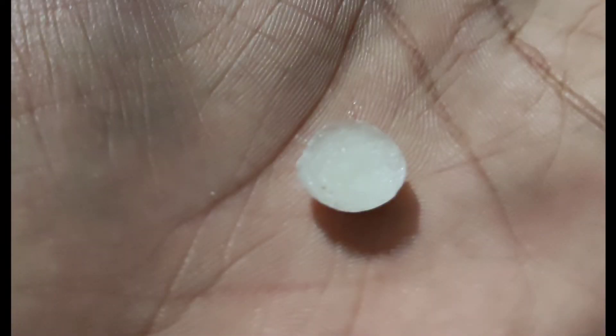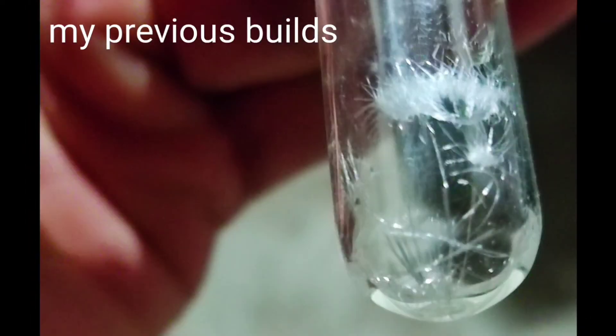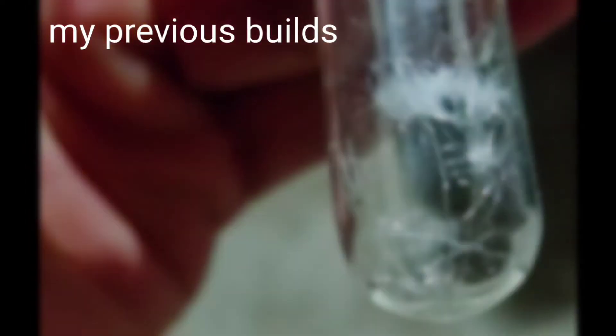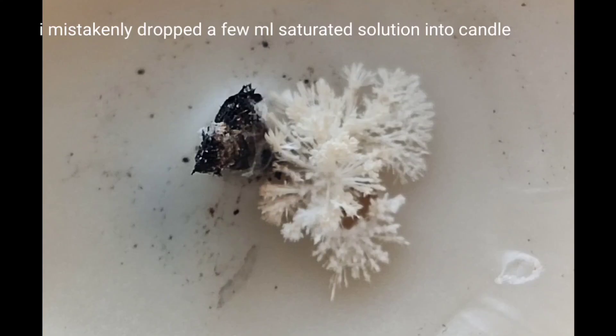This previous one is not the current batch — this is the current one. You can see the crystal shape; it looks whitish because there is water trapped between the crystals. Under the microscope you can see what kind of crystals are there. This is from my previous build where I let it evaporate without any heating at all — it took two weeks, but you can see very beautiful crystals. This is when I dropped a few ml of saturated solution into the candle setup.